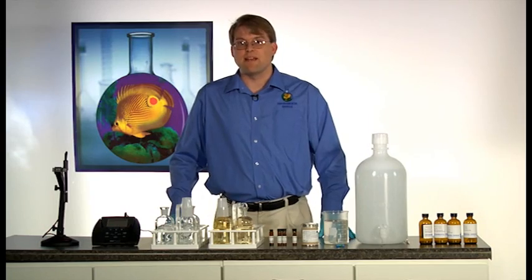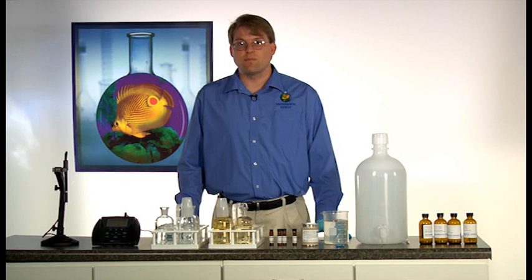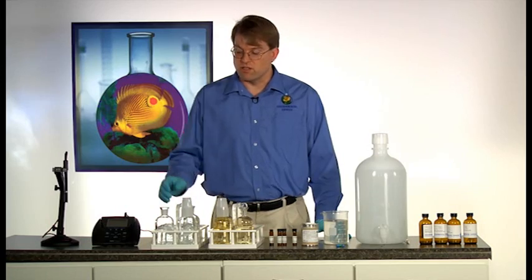After you have obtained adequate dilution water and prepared your seed and added your standard, you need to decide which bottle you would like to use for your BOD batch.